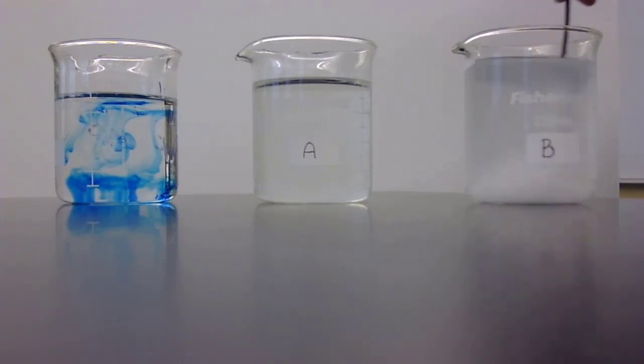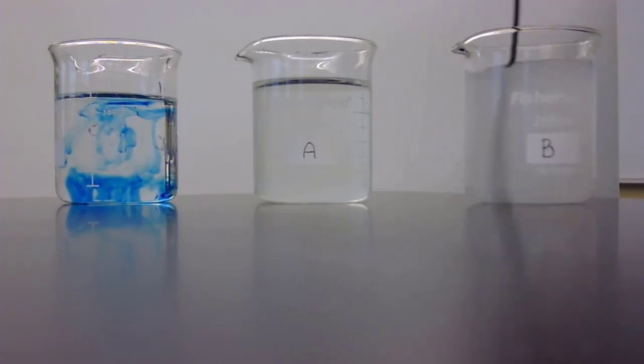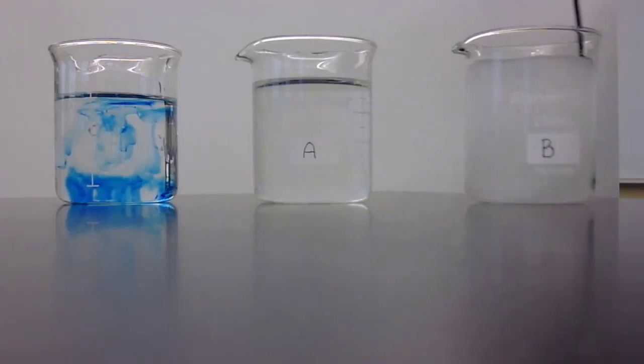But what we are doing is we are making a hypotonic solution relative to the potato, and hypotonic means that there is less stuff dissolved in the solution than in the potato, and a hypertonic solution, which is the one that's going to have all the salt in it, which has a higher concentration of stuff in the water than in the potato itself. Or that's the theory anyway.